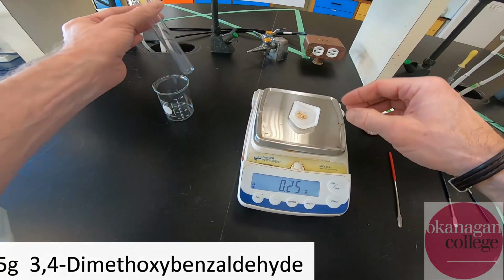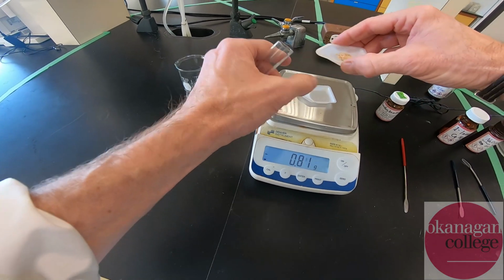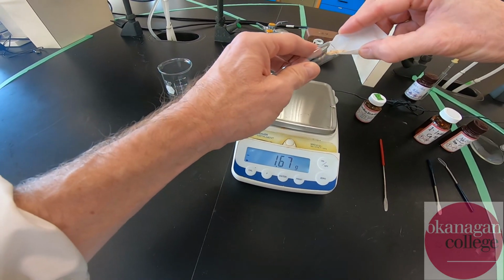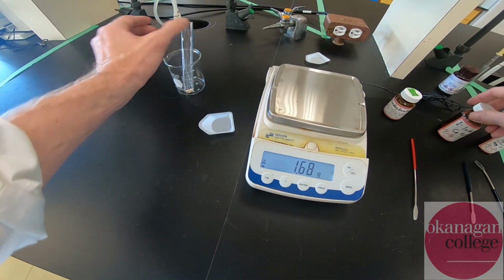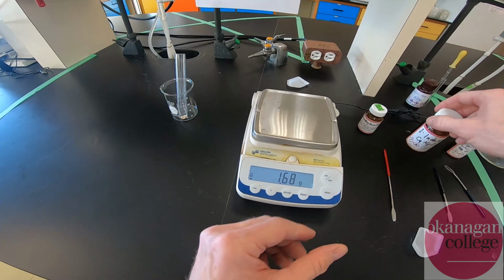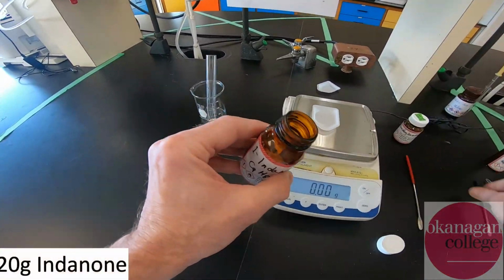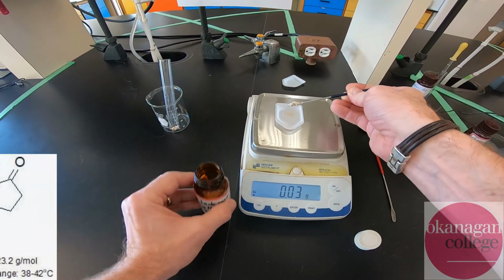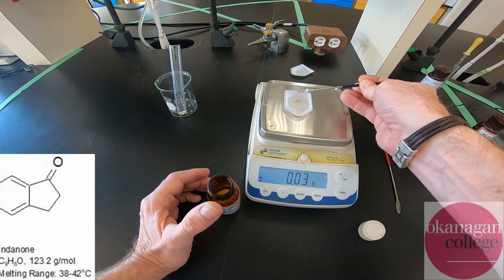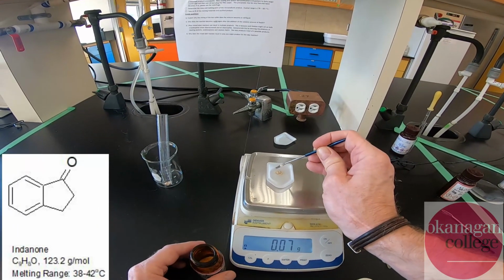All right, so I'm going to transfer that into our reaction vessel, which is a good old-fashioned garden variety test tube. The indanone, again, very low melting point material. We need 0.2 grams of that. And again, you can see that it's a light brown color, probably suggesting a small amount of impurity. So both the starting materials are likely impure.